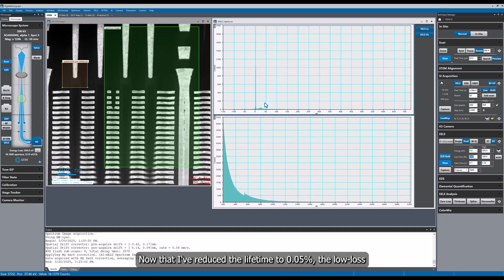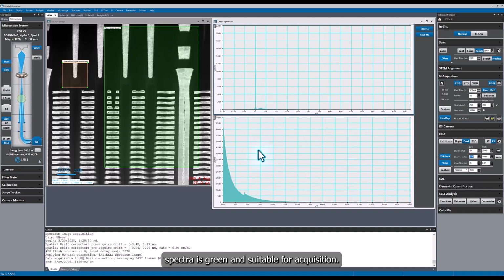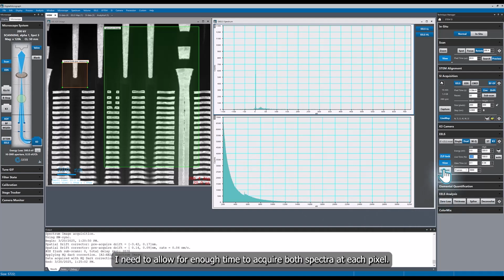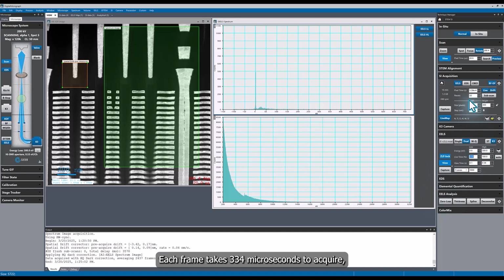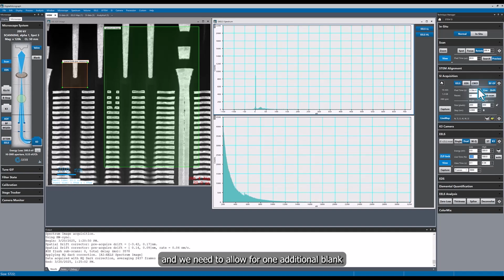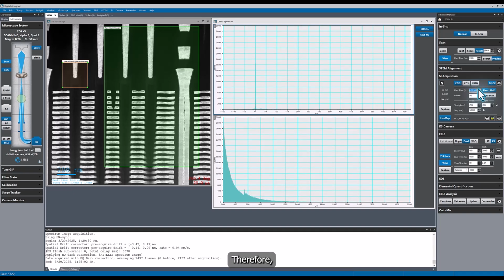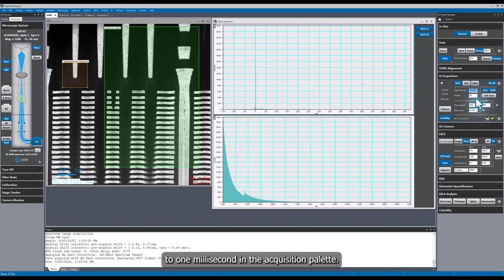Now that I've reduced the live time to 0.05%, the low loss spectrum is green and suitable for acquisition. Since I'm collecting a dual EELS pair at each pixel, I need to allow for enough time to acquire both spectra at each pixel. Each frame takes 334 microseconds to acquire, and we need to allow for one additional blank frame to clear the data from the previous frame. Therefore, I will set the pixel dwell time to 1 millisecond in the SI acquisition palette.